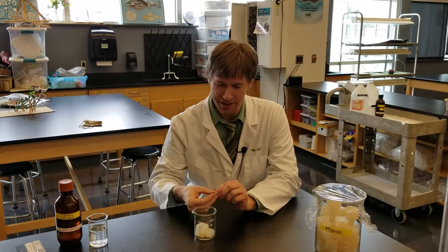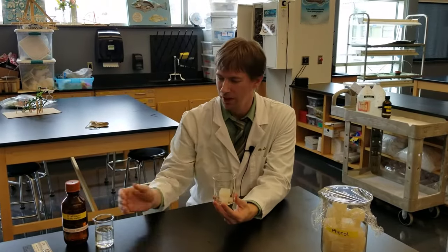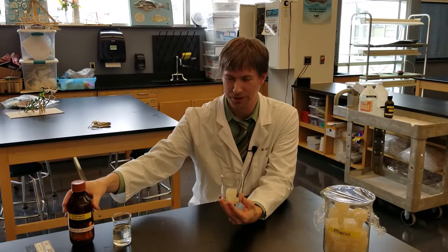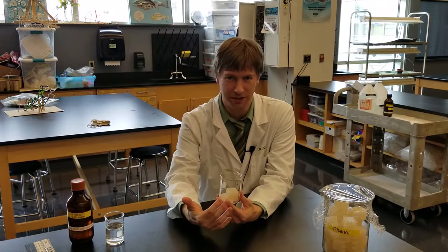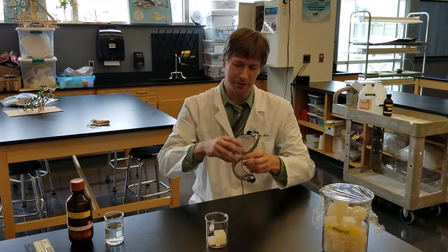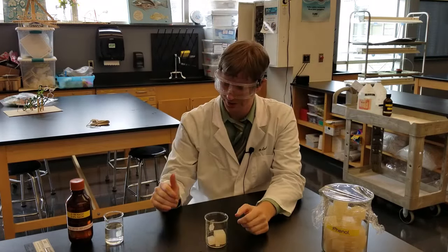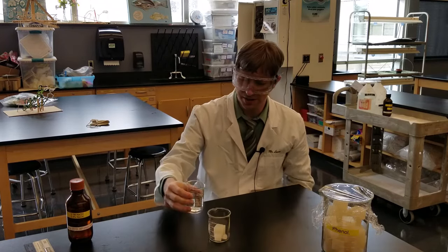The important thing is that they all sit on the bottom — I don't want to stack them. When I pour the sodium hydroxide, notice I have a separate beaker, not straight from the stock solution — we never want to do that. As long as the NaOH is covering all three cells, we're good. Since I'm using chemicals, I want to make sure I have my goggles on. So here we go — we're just going to pour this over and watch the magic magenta come out.